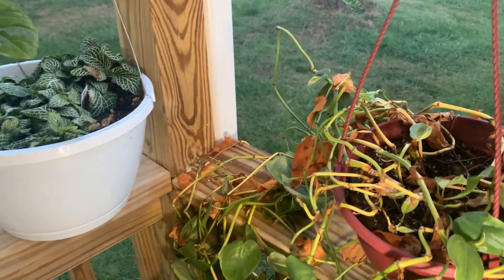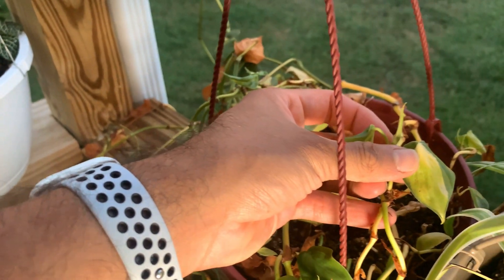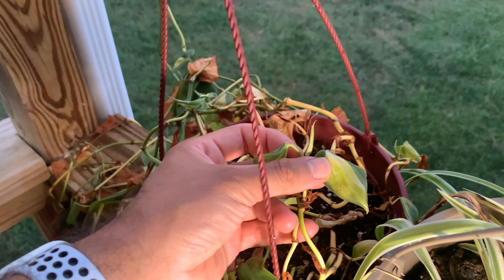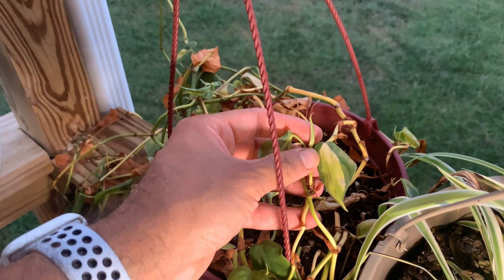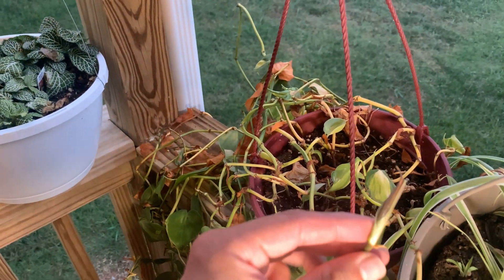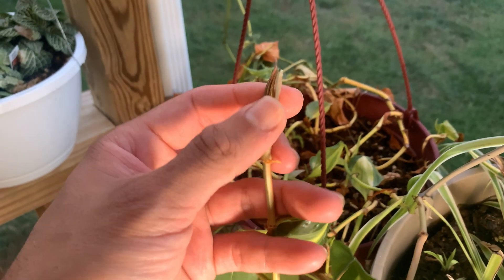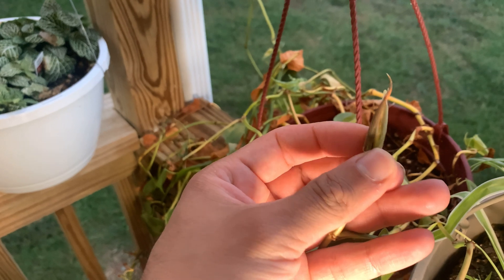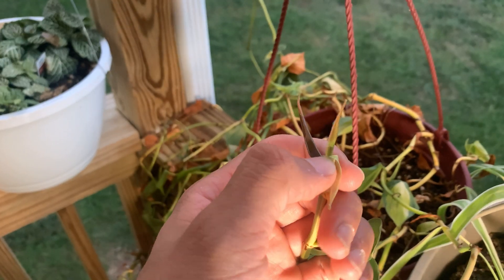What I'm doing essentially is taking the ends — right here, I'm taking the very ends of the growth. Excuse the fireworks; it is the Fourth of July, so I hope you have a happy Independence Day. This is what I'm taking here — I just take the very last growth of the plants. Some are still closed, and some are open. This one here is already open, and it's a lot more difficult to sterilize because you have to remove part of the leaf to sterilize this part. If I open this, I can take this part right here where this is the new growth.